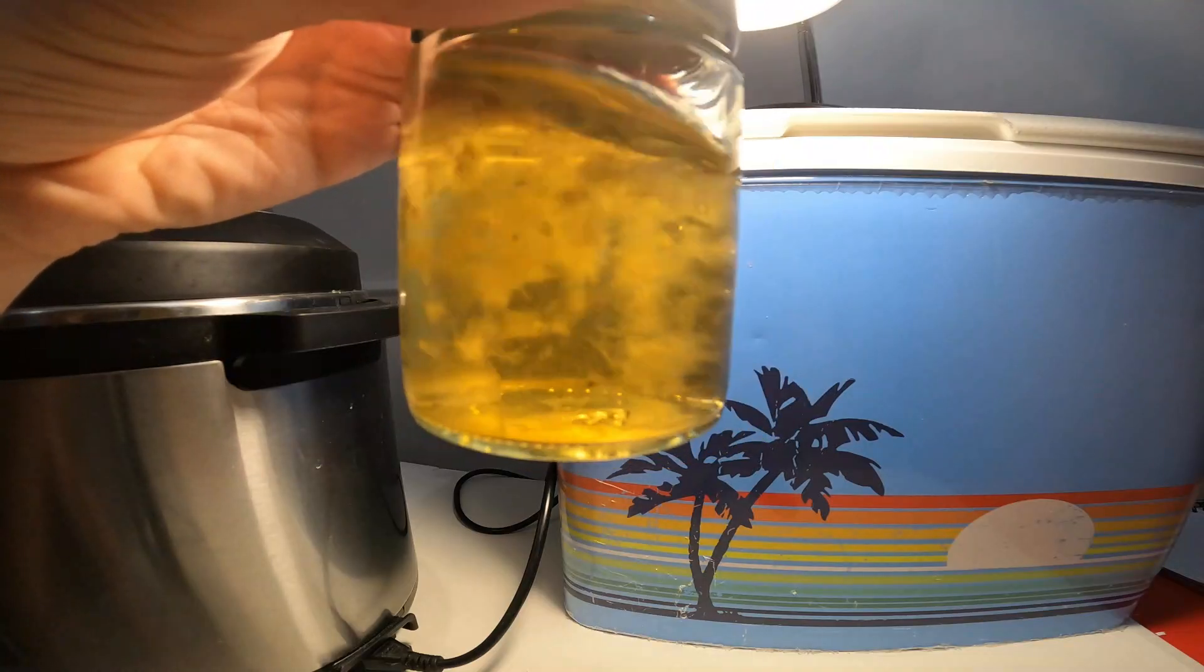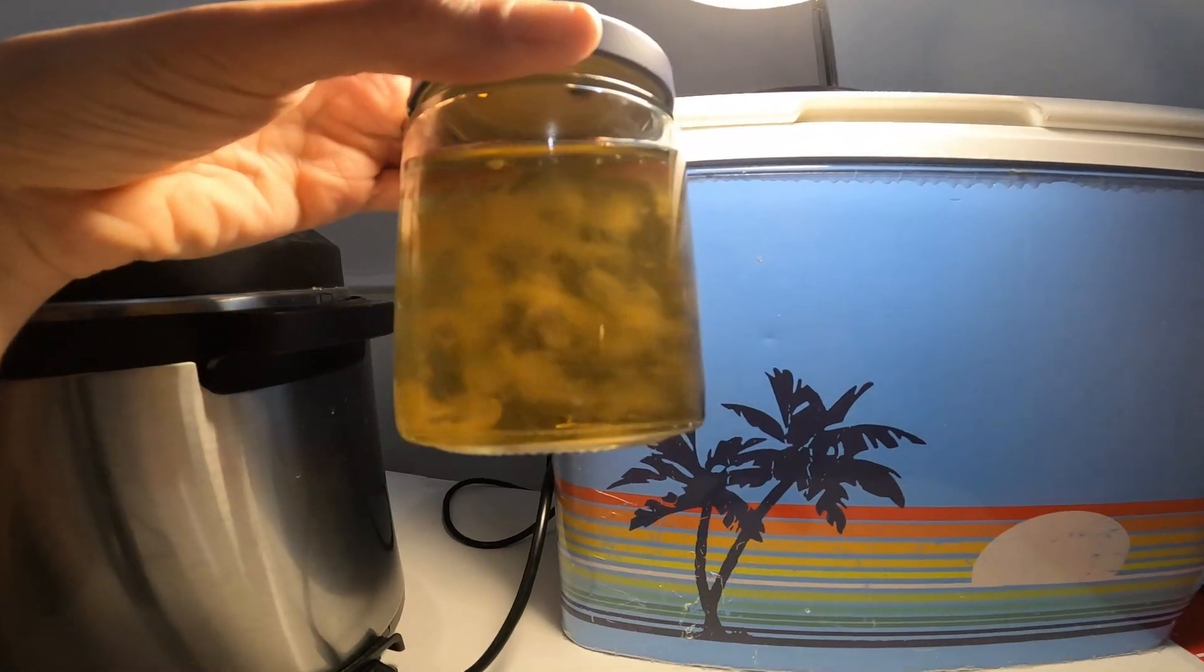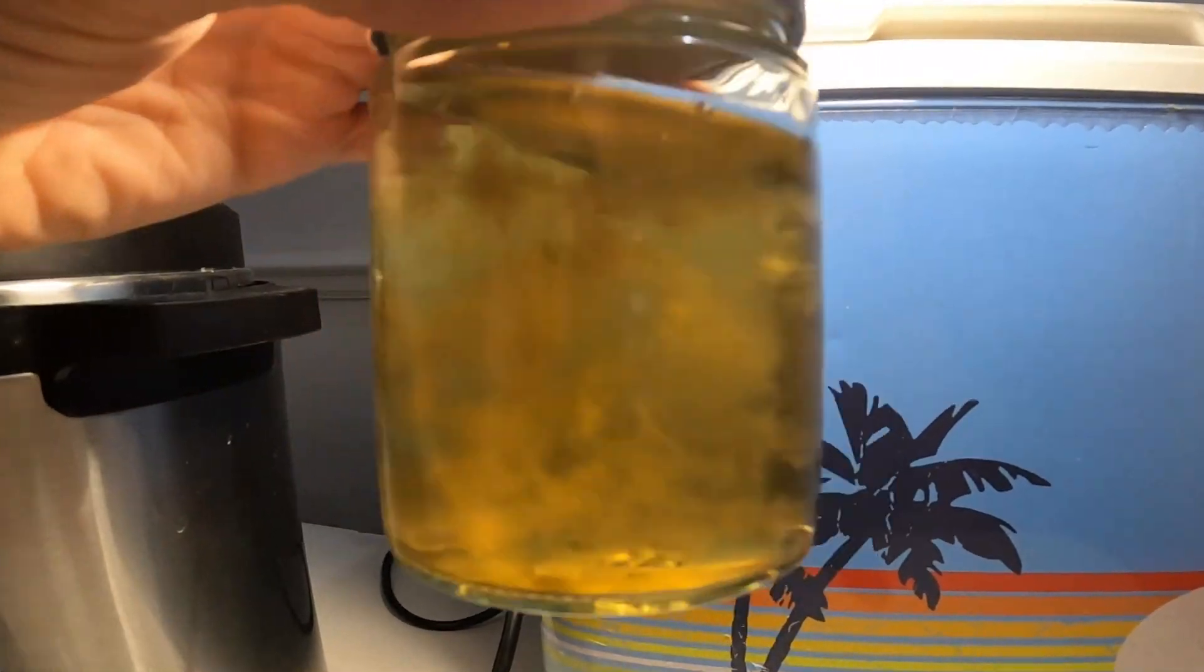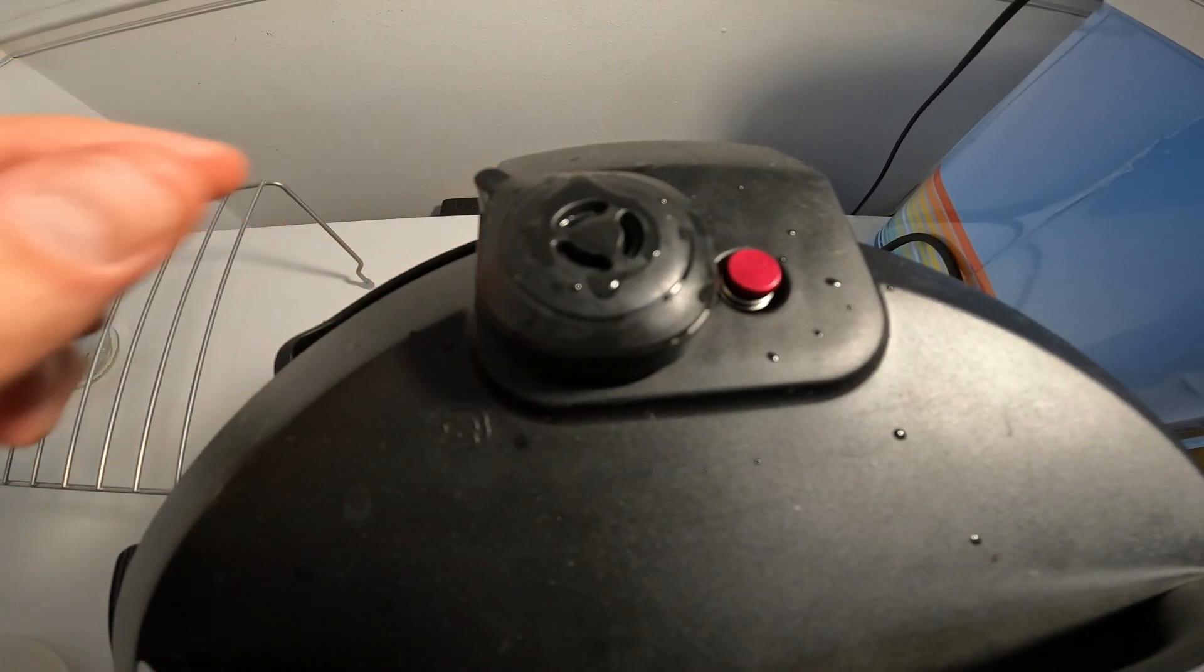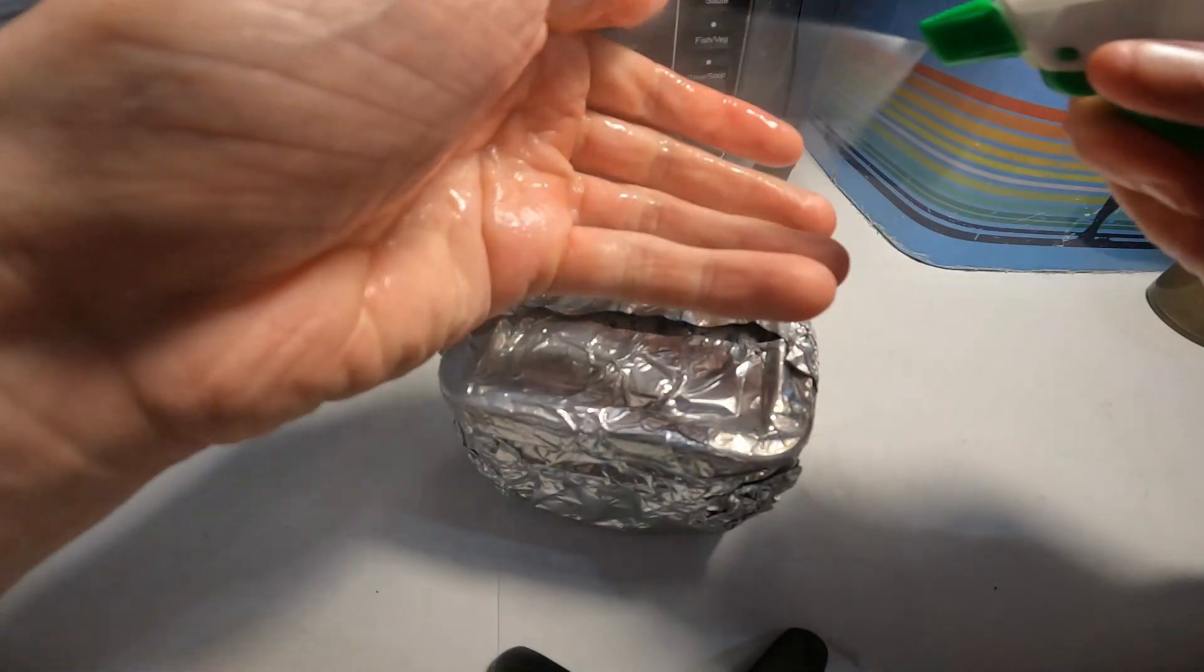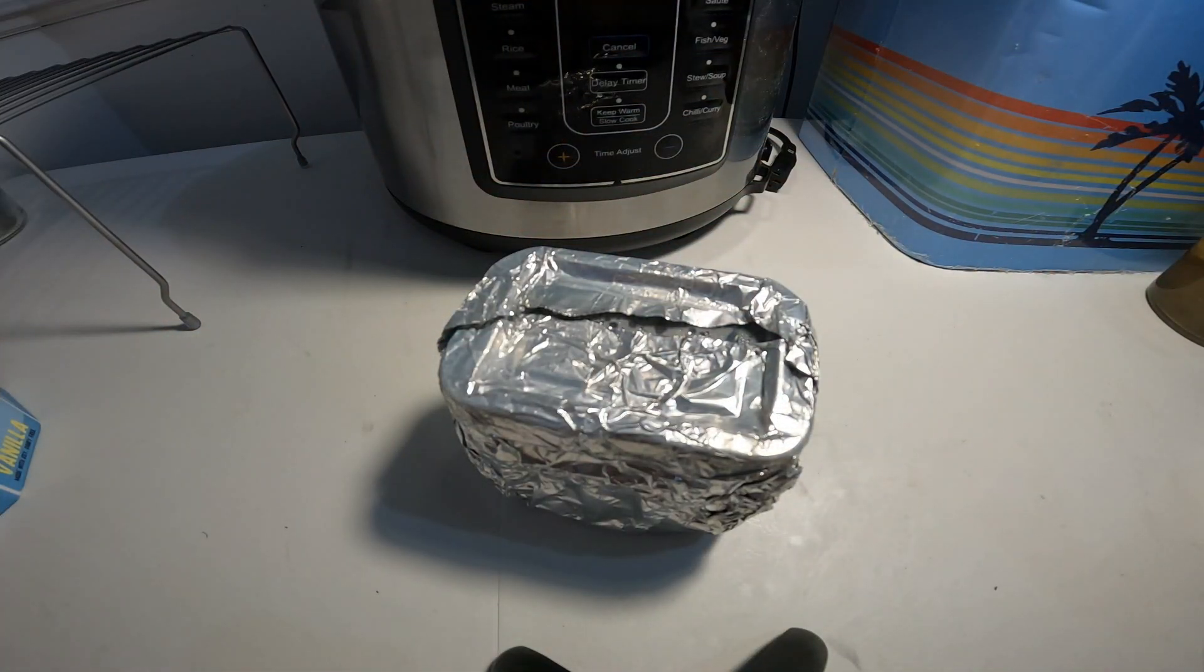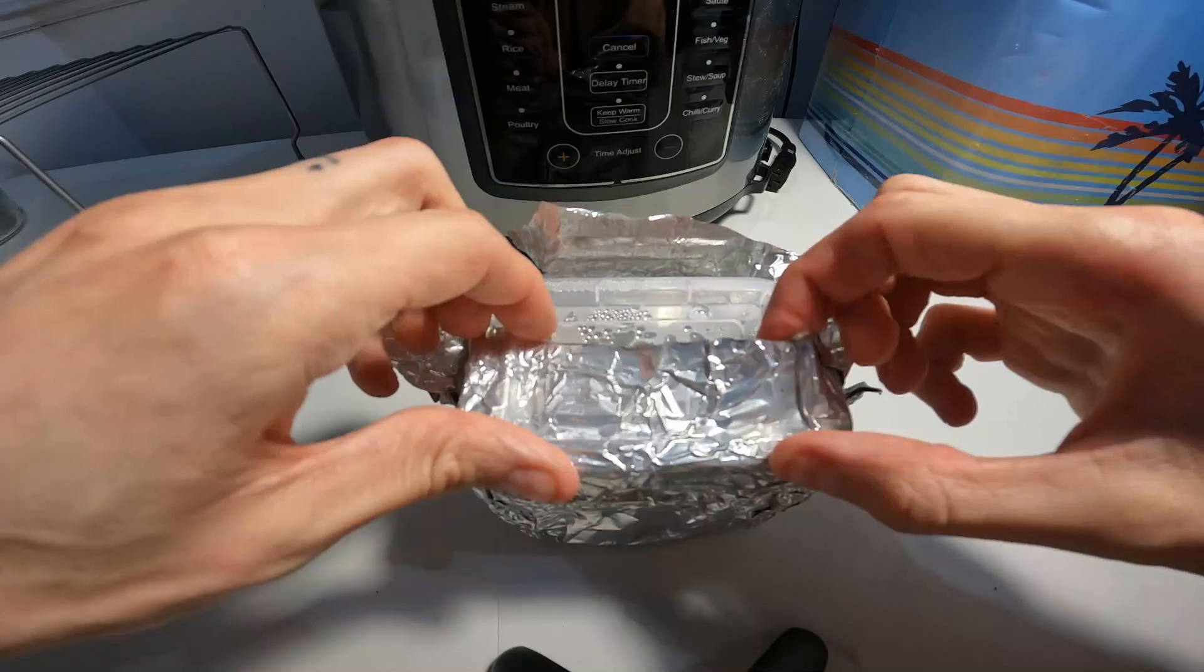In the meantime, I play with this probably contaminated liquid culture. Once the 40 minutes is up, I remove them from the pressure cooker as soon as possible because any radiating heat will keep any small particles away from them while I'm working.